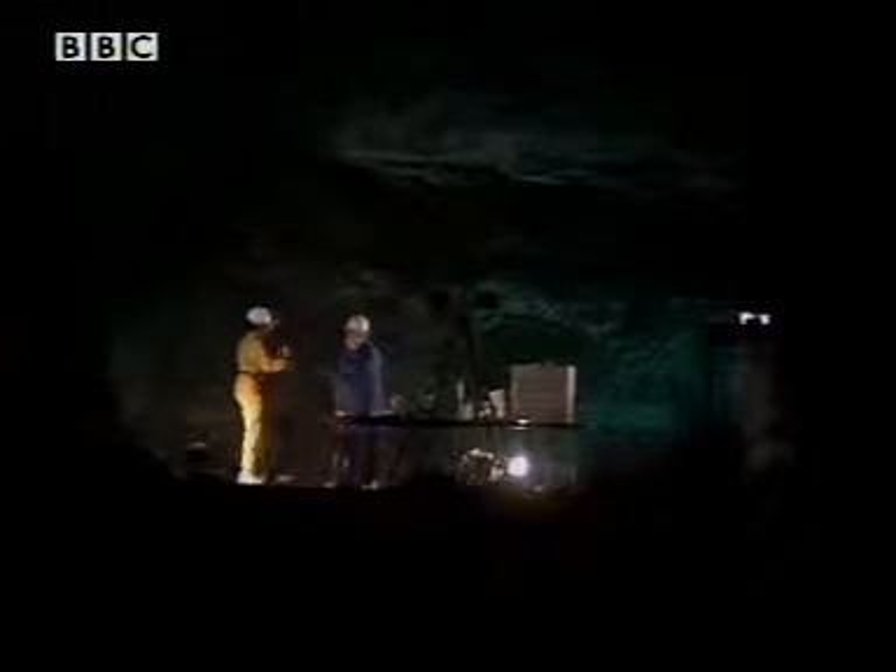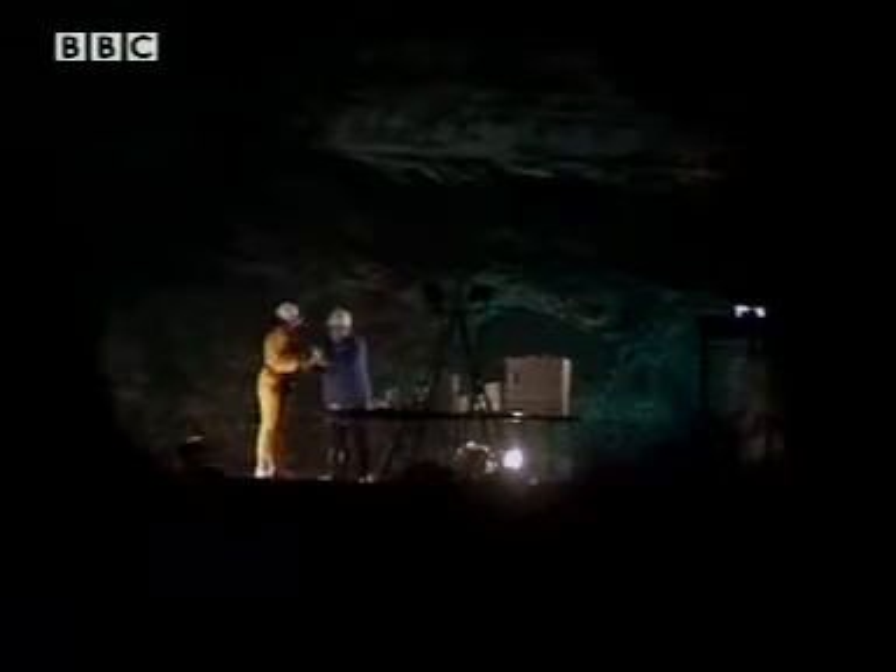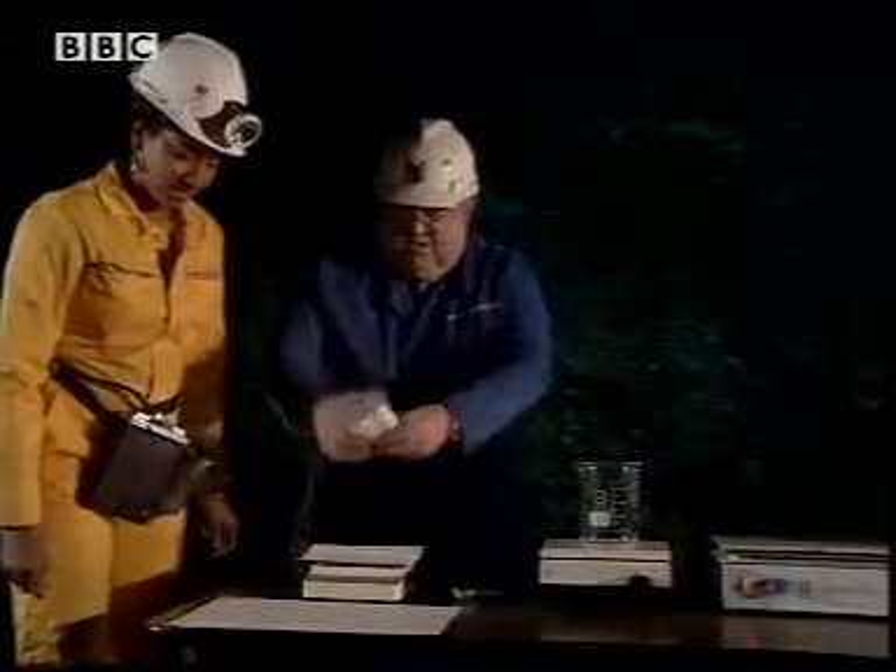Hi George. I've collected my rock salt sample for analysis, so what do I need to do? Well done Trish, I'm going to put the rock salt nicely on the weighing paper.